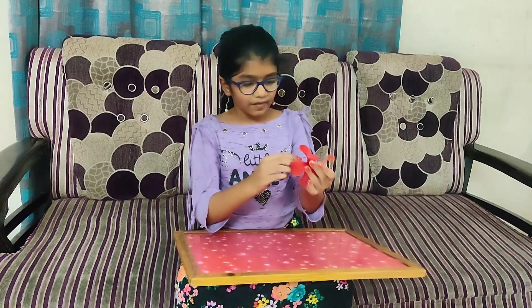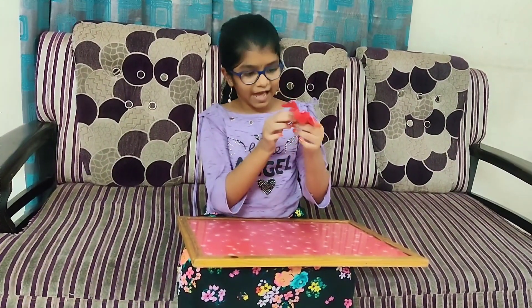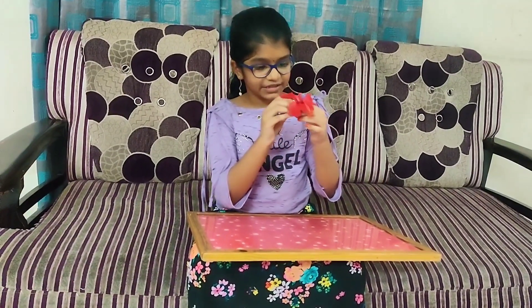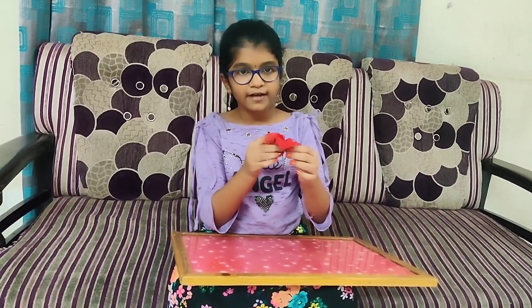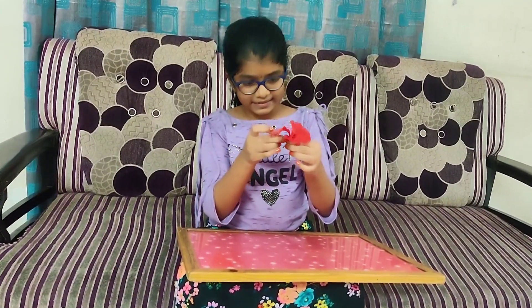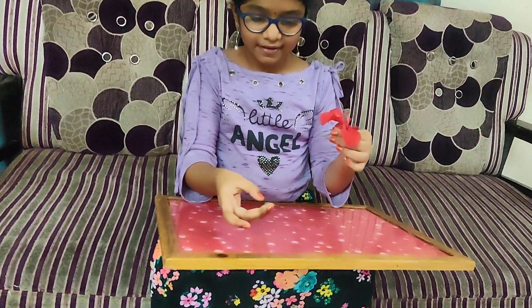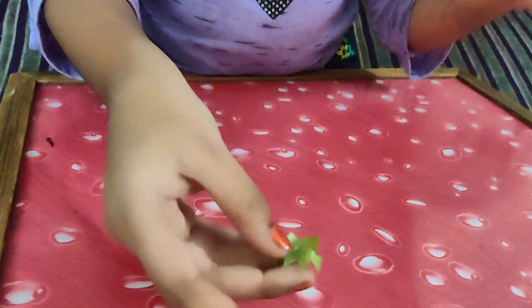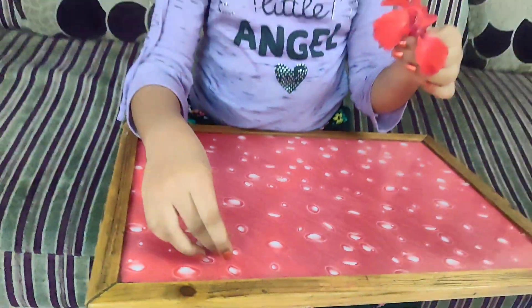First, sepal. Sepal protects the flower during the bud stage, and it also provides food during the bud stage. Sepals are green in color. This is sepal. The other name for sepal is calyx.